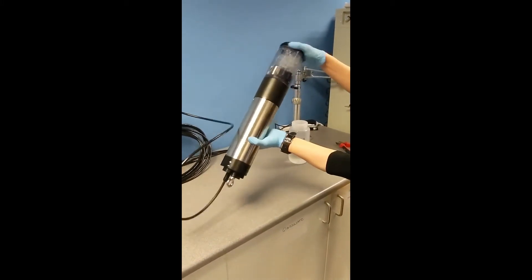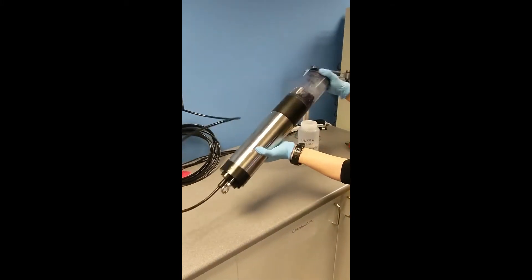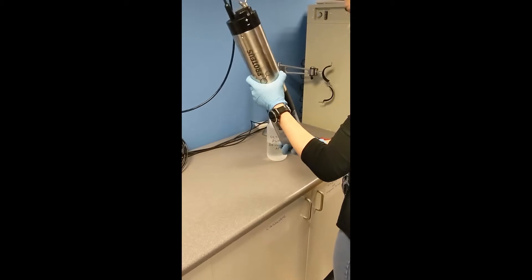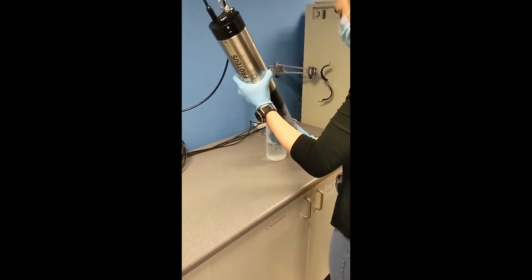And then shake it around to rinse all the sensors and make sure it's clean.